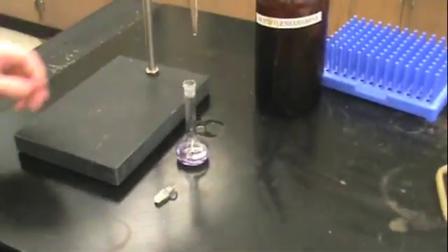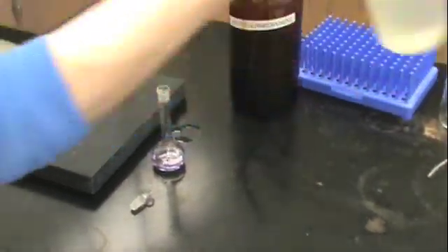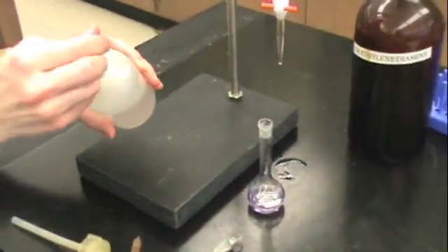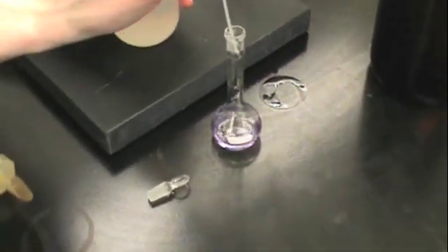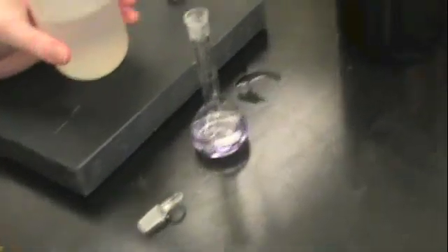Once you have added all the necessary reagents, get your distilled water and feel free to either use a dropper to add the water in case you have a small volume that you need to add, or just use your distilled wash bottle directly.